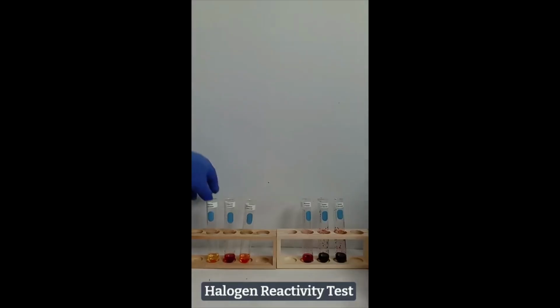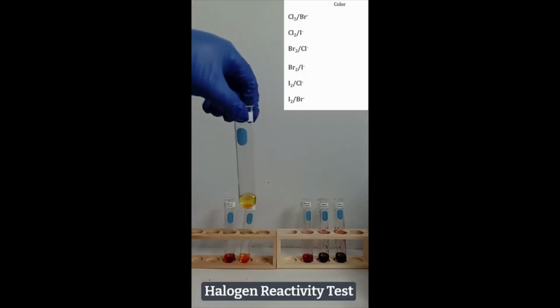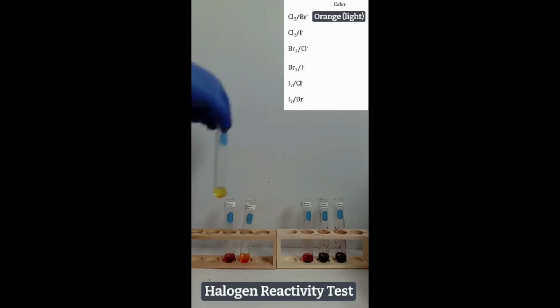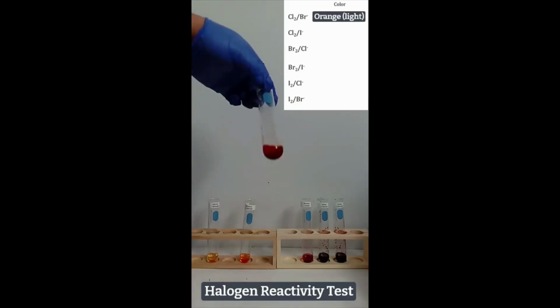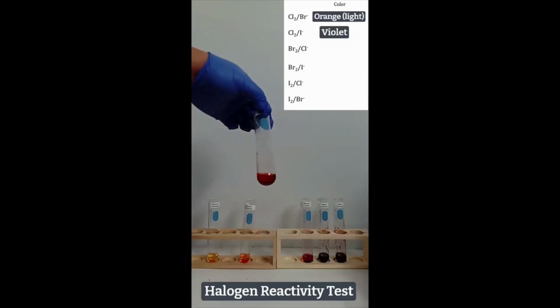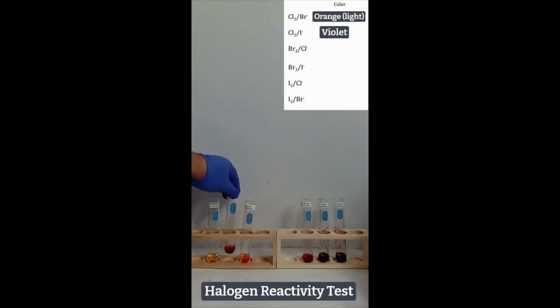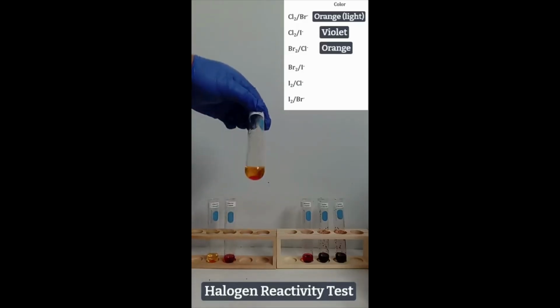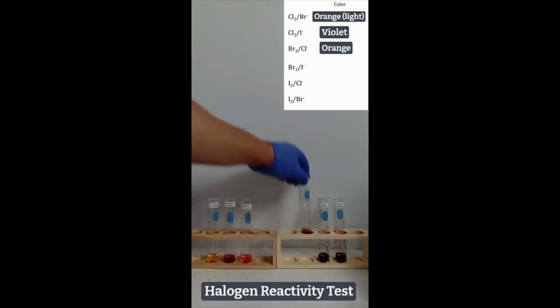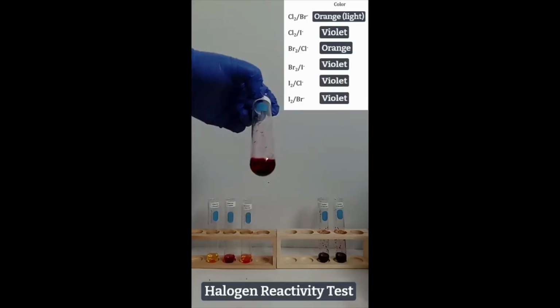From left to right, once the addition of methylene chloride has completed and mixed, the colors of the organic layers are light orange, violet, orange, and violet in the final 3 test tubes.